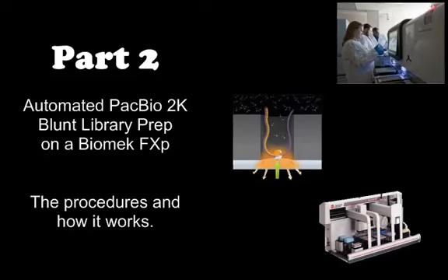In part 2, I'm going to go over the procedures that are used in this method and the logic that's used to call the procedures. If you understand how this method works in the procedures, you should be able to modify it for your particular labware or your instrument setup, your hardware that you have, or you could actually change the method for a different application. The procedures are the building blocks of this method.